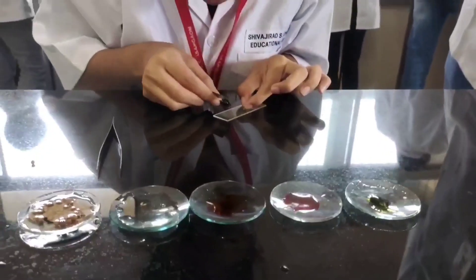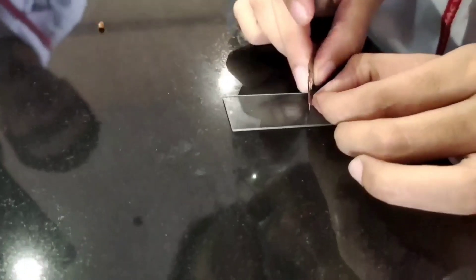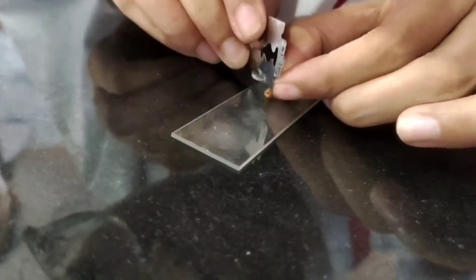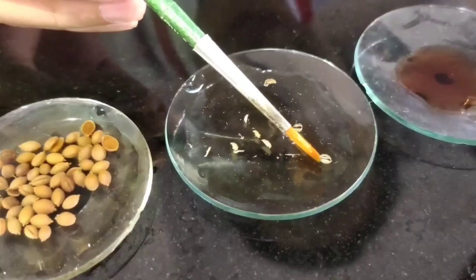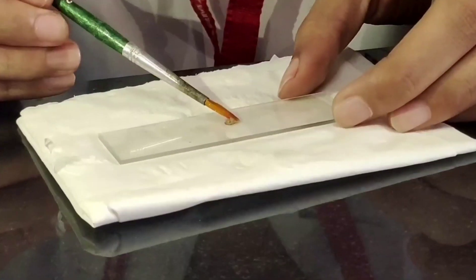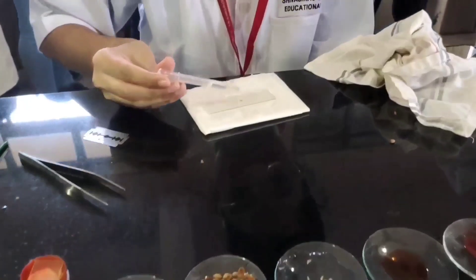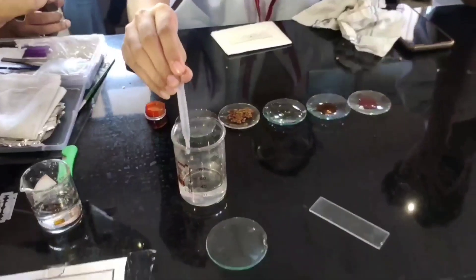For thin, plain and proper sections, you should sit comfortably on a stool with full concentration, as shown in our video. From the sections, we select the thinnest section to observe under the microscope. Then add a few drops of glycerine water and place a cover slip. Clean the slide properly before placing the cover slip.